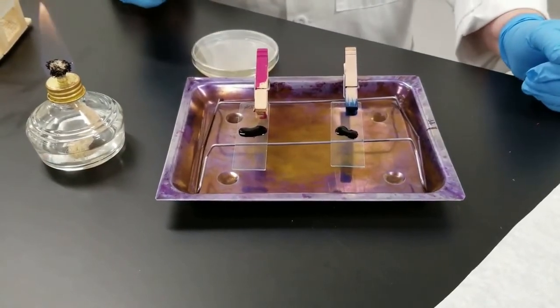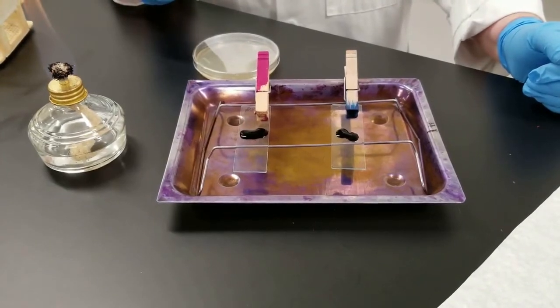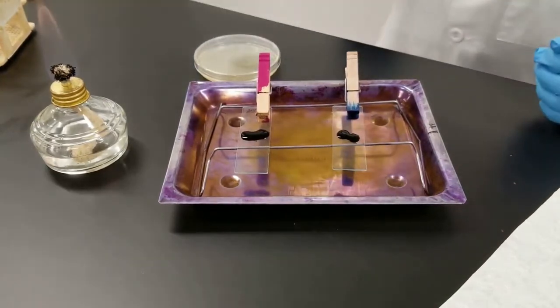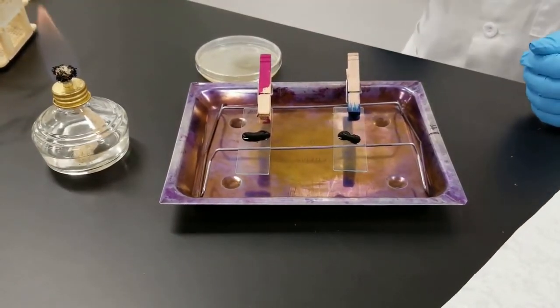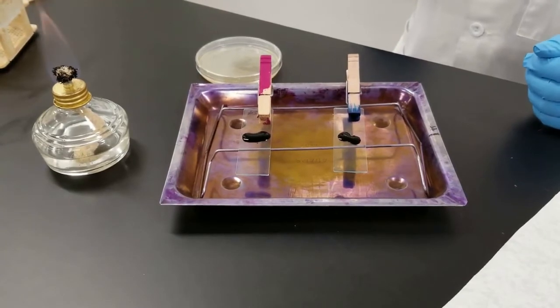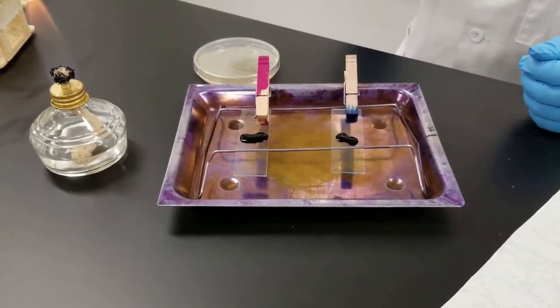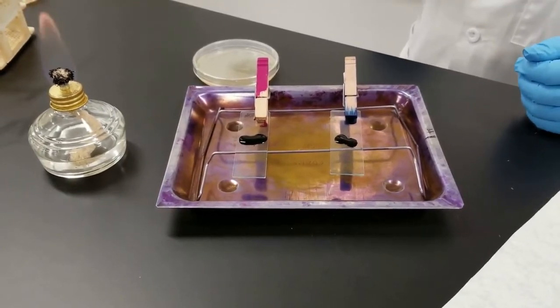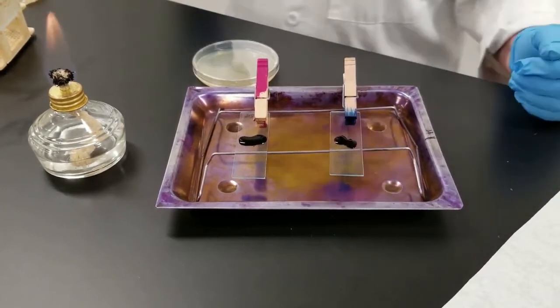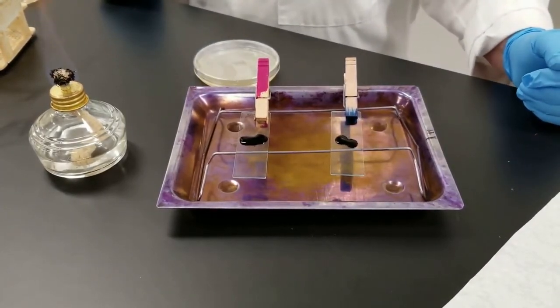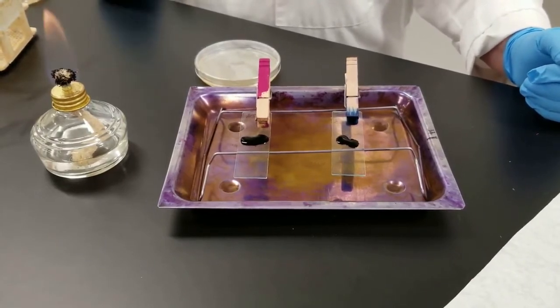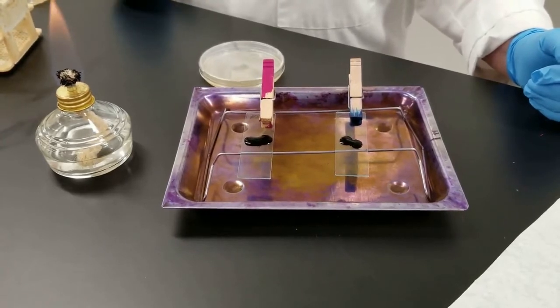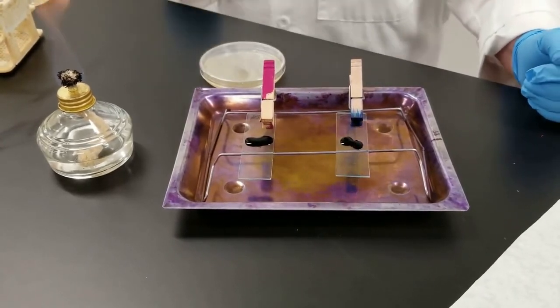The timing on this is critical. The Gram stain is going to use, as I said, two different dyes, so we can distinguish between organisms. The first dye, or the primary stain, is this Crystal Violet. All the cells are going to look kind of a bluish-purple color if you were to look at it right now under the scope. This Gram stain was named after the person who developed it. It is probably the most basic and most fundamental and important stain that we do in microbiology.